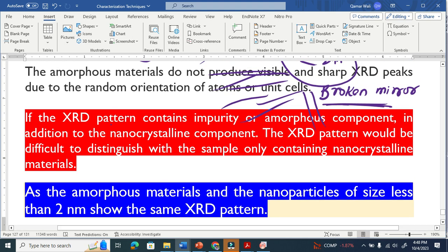Consider an XRD pattern that contains impurity or an amorphous component in addition to the nanocrystalline component. For example, if we have a material here, this is nano, and this is amorphous, there is a disorder in the material, and here is again nano, and here is again nano. So how will you know that the XRD gives you a broad peak, and whether this peak is from nano or from impurity? For example, okay, this is one case.